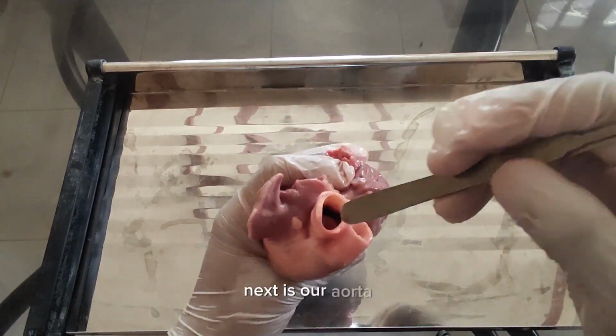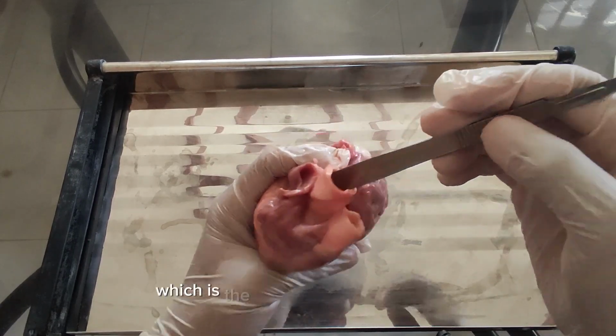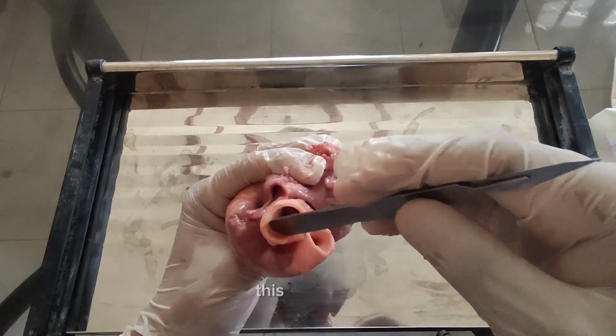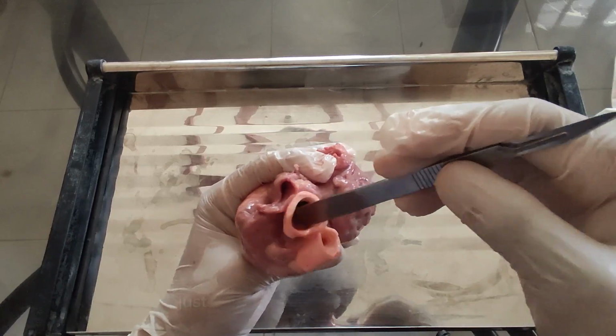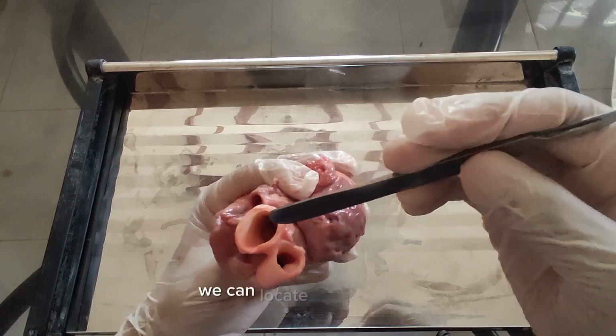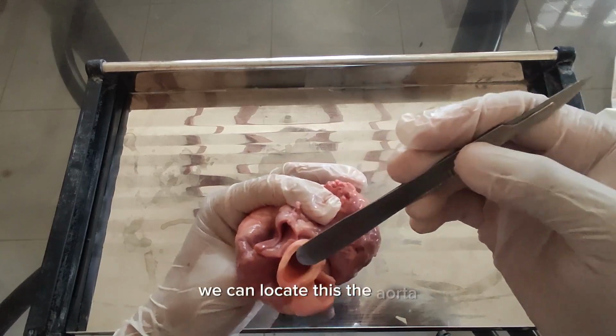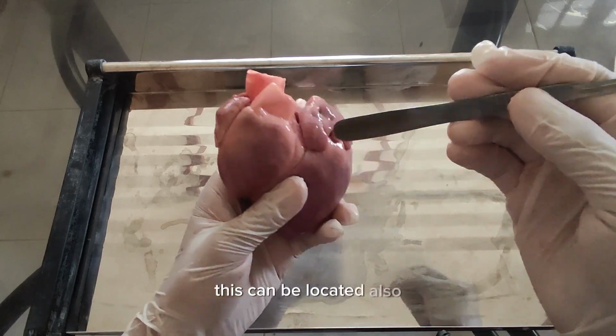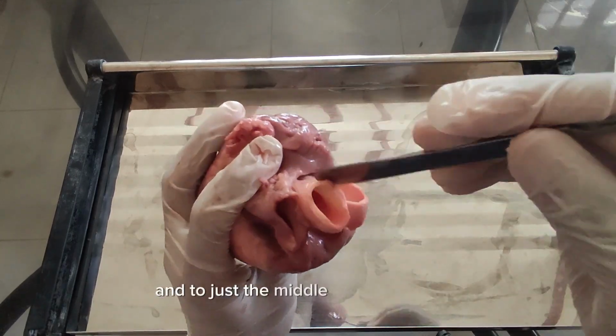Next is our aorta, which is the major vessel of our heart, the biggest artery in our body. This, the aorta. Just behind the pulmonary artery, we can locate the aorta. This can also be located in the middle part of the heart.